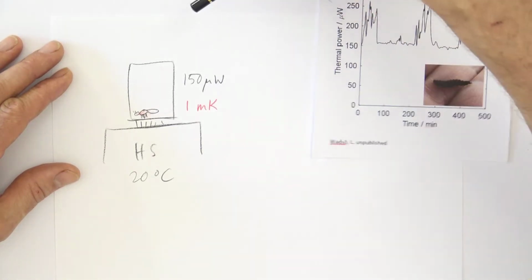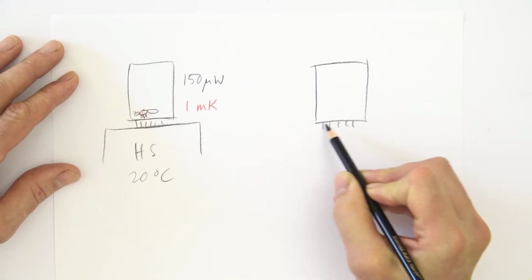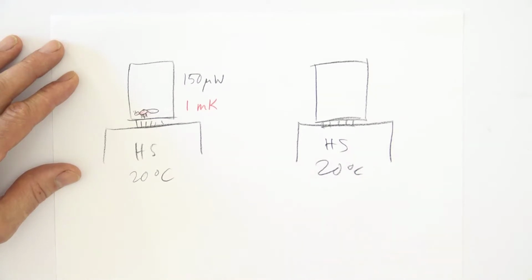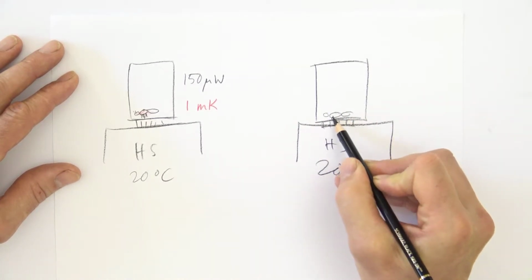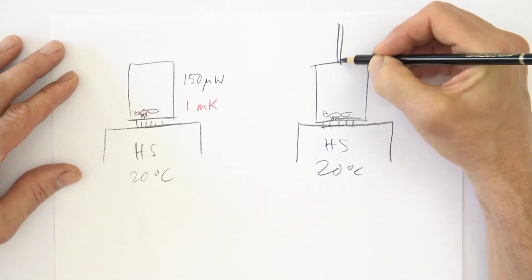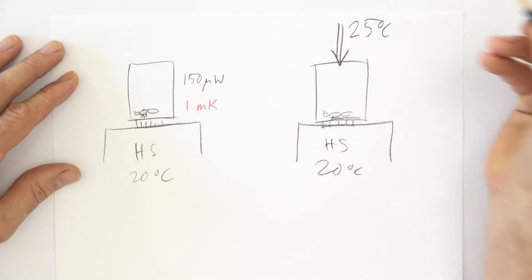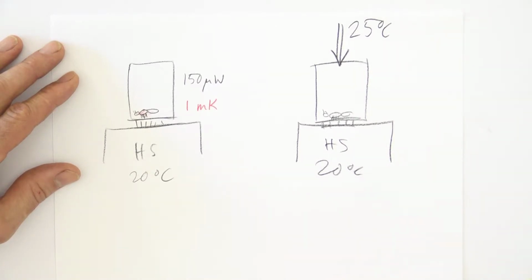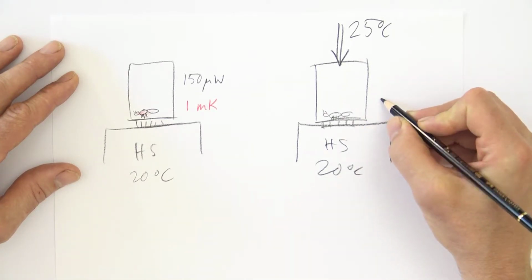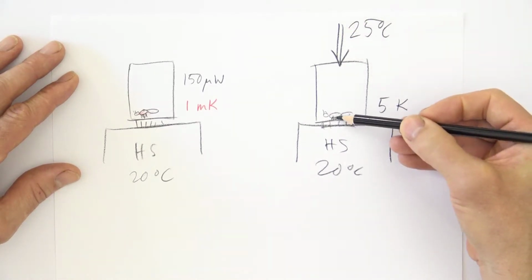Now let's look at the case when we have initial disturbance instead. So I will draw the same calorimeter. Like that. And let's say we have the same insect also in the calorimeter. Now we have just charged the vial, and the vial came from a room which was, let's say, 5 degrees warmer than the calorimeter. So this means that we have an over temperature here of 5 K, and that's just when we have charged the vial.